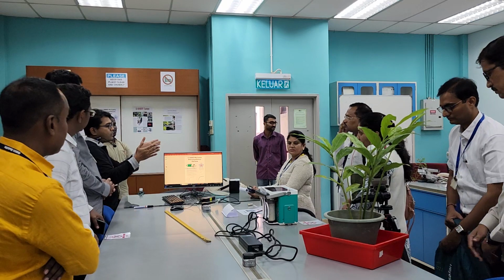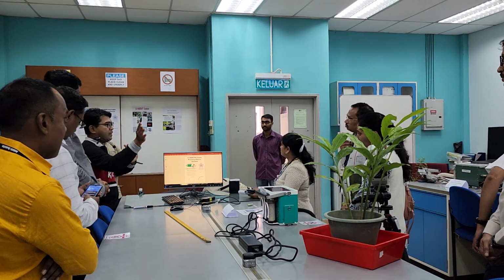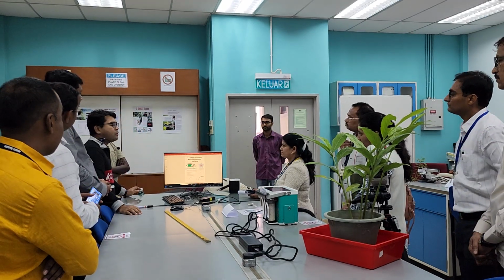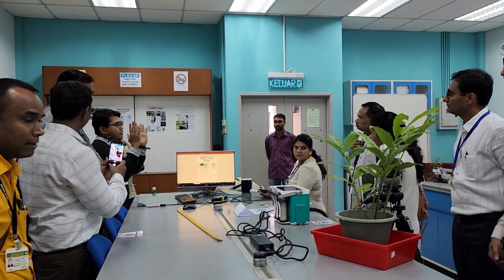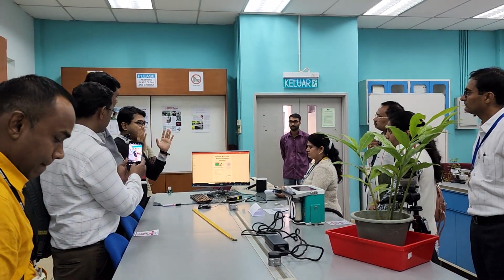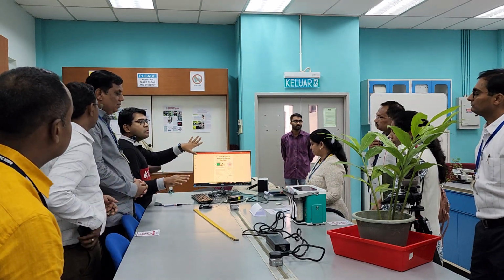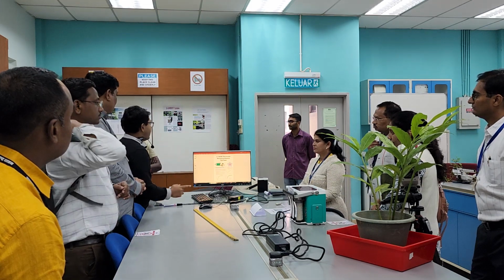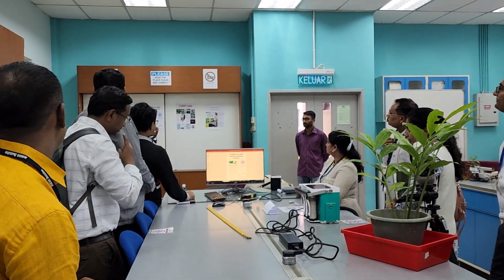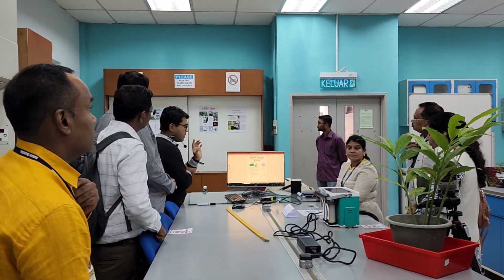So as you know, when we look at the crop that we have treated with anything, fertilizer, light, CO2, and so on, we can decide at what level of the plant we want to do the assessment. It could be the root, soil level, the plant level, or the canopy level. So for today, we have a number of equipment that can fit into that purpose.